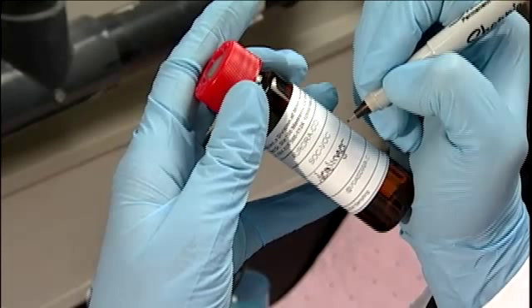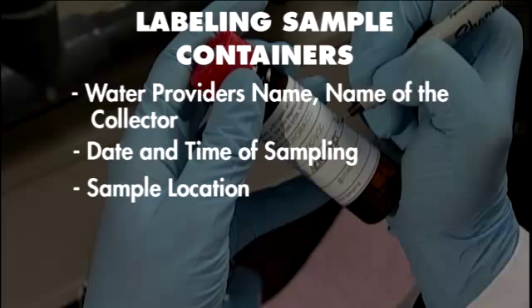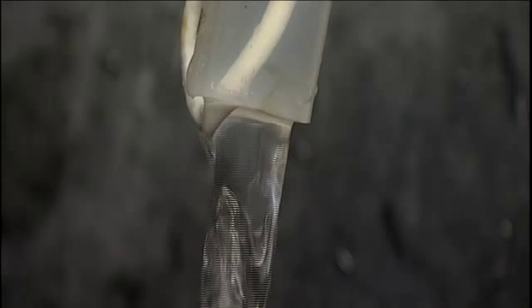While the tap is flushing, label the container. All sample containers should be properly labeled with the utility or water provider's name, name of collector, date and time of the sampling, and the sample location. Also include any sample code or pre-assigned sample number, parameters to be analyzed, and preservatives if any.